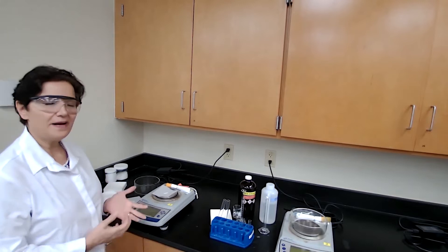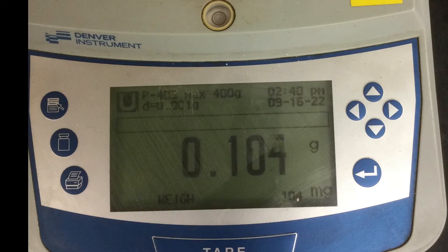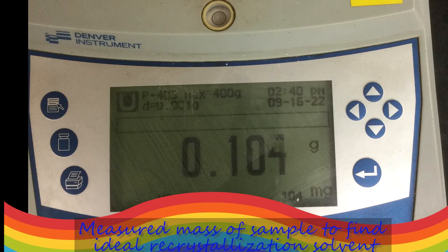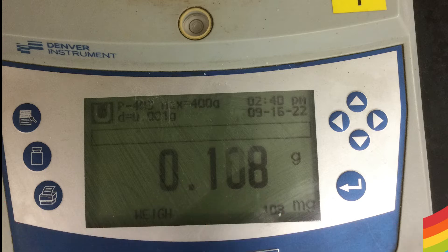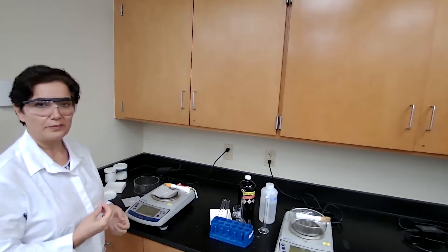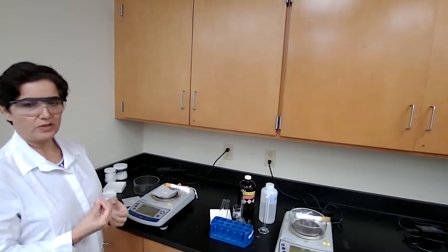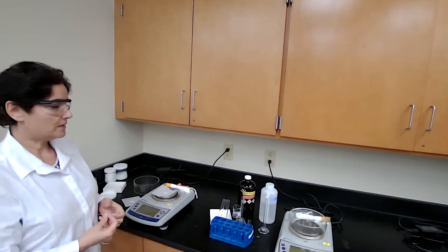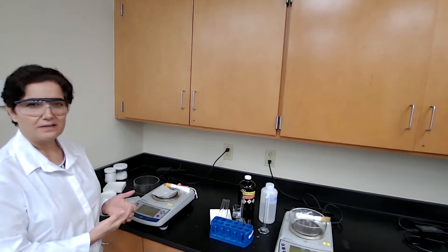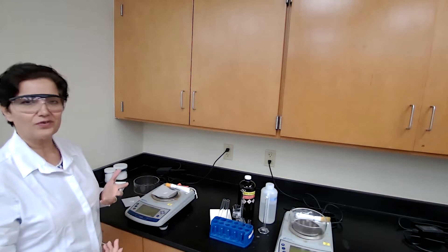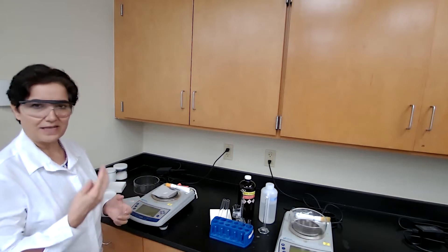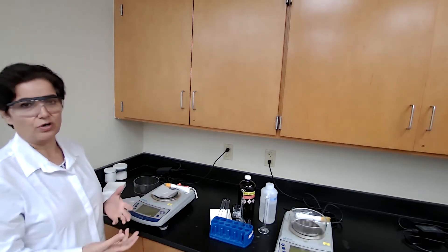For the experiment, we are going to follow the procedure. For part one, we're trying to find what would be the better recrystallization solvent. I made it easier for students - I just gave a choice of two solvents to try.